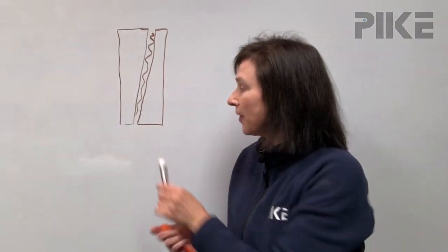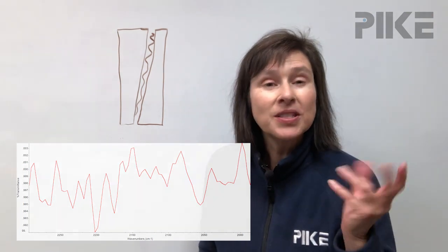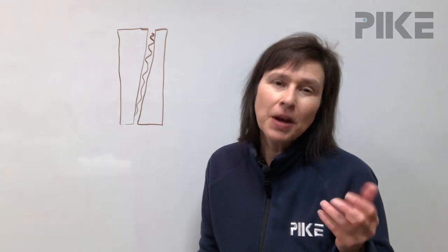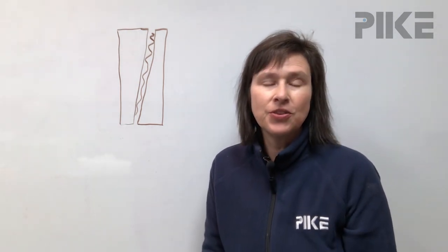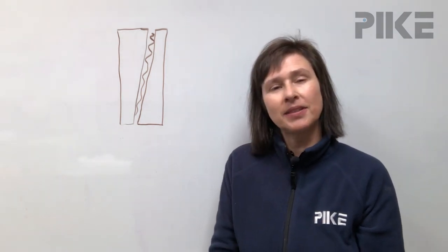If you don't orient these windows properly, what you're going to find is your cell's going to leak and you may still see a fringing pattern. And lastly, once the windows have had time to orient themselves, you're going to notice you probably are going to have a little bit of a rattle in your demountable cell once it's assembled. So let's take a look at how I assembled my demountable cell.